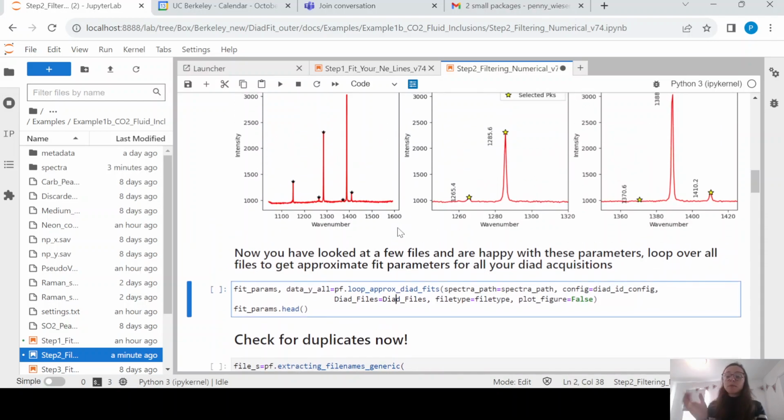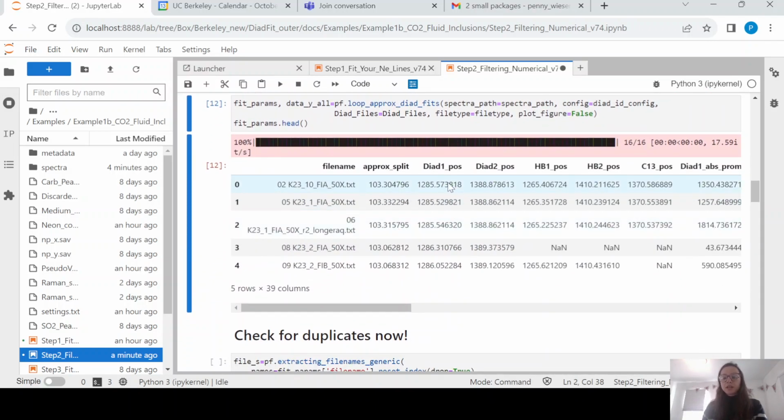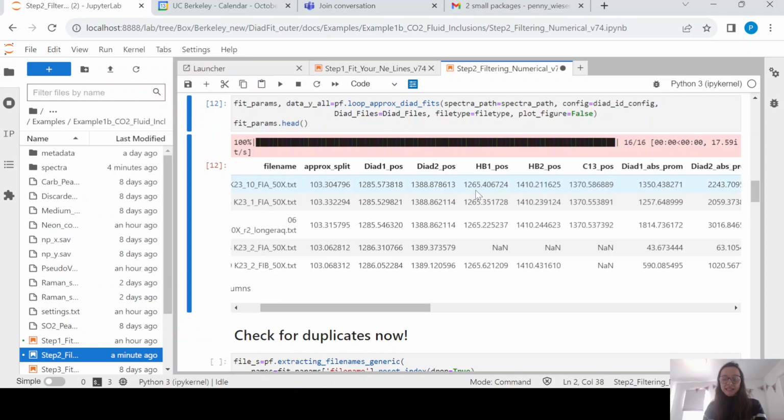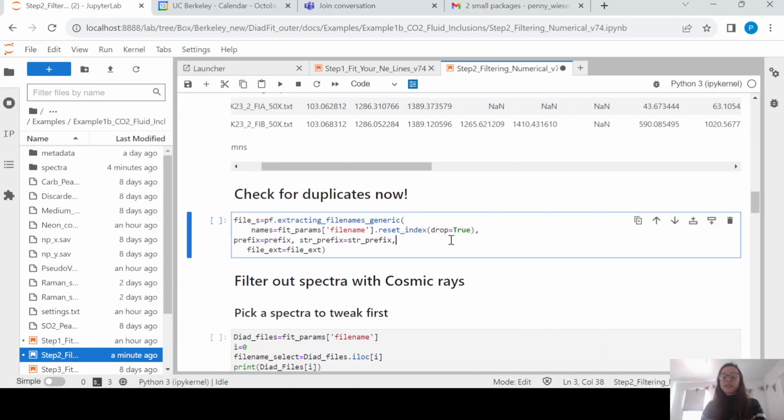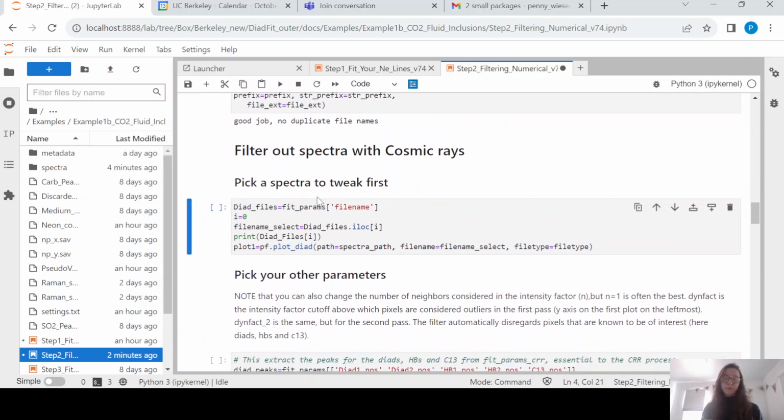Now what we're going to do is loop this SciPy find peaks algorithm over all of the files. And this is going to give us the approximate positions of the diad and the hot band in each Spectra file. So you can see here, the approximate position is this. If it found a hot band, it's given the position, otherwise it's put a NaN in. Okay, final thing we're going to do is check for duplicates. You do not want to have given the same name to more than one Spectra. When you go to merge that with your metadata, you're going to have a nightmare. So we are checking for that now, because if you've got it wrong, you're going to want to rename your files now before you go through the effort of fitting them. So you can see here, it's checked through all those names and it hasn't found any duplicates.